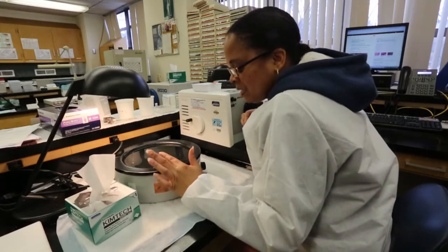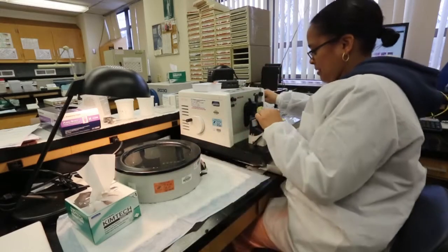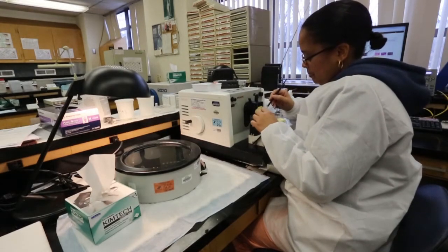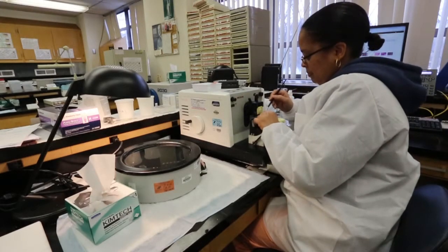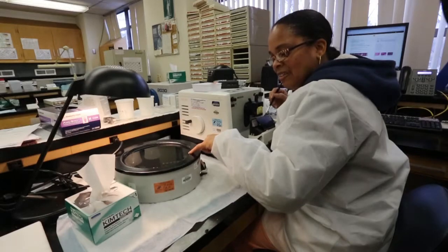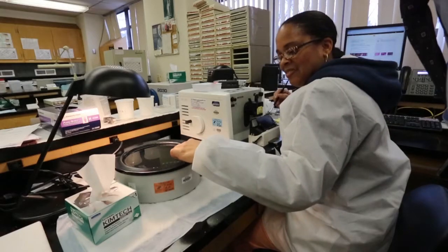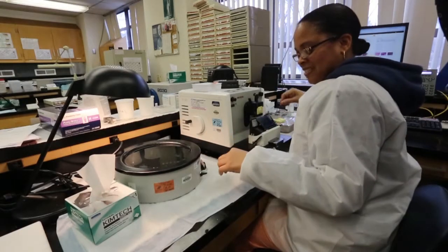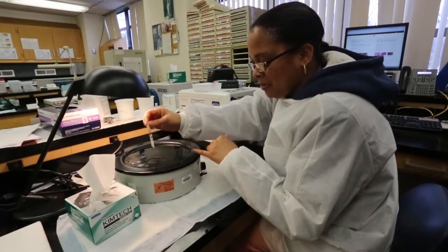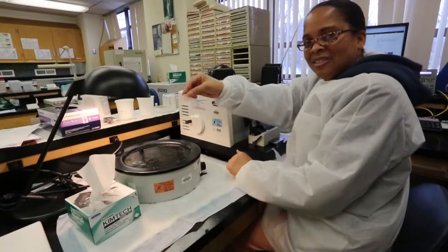Sometimes I just look at it to see if there are wrinkles — see how they're there? The light reflects off the wrinkles, so I wouldn't pick that up yet. I want to pick up the one that doesn't have too many bubbles in it. And that's the section — and it looks just like your block, which it should.